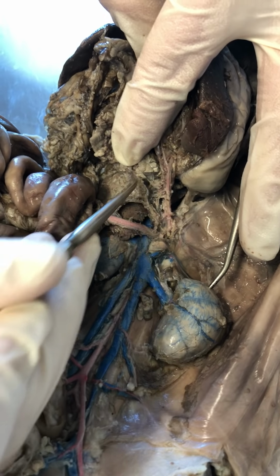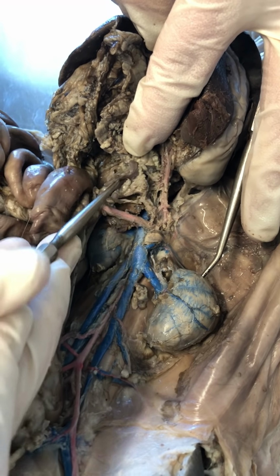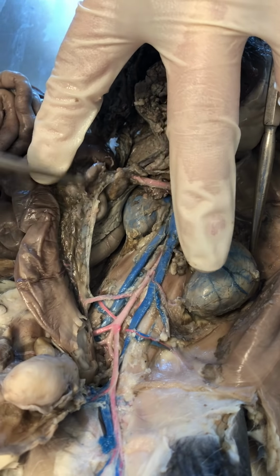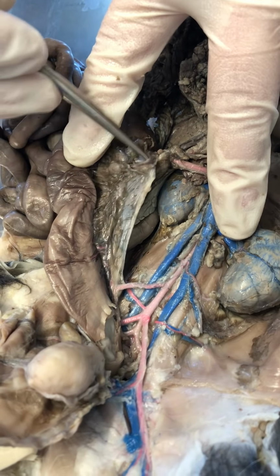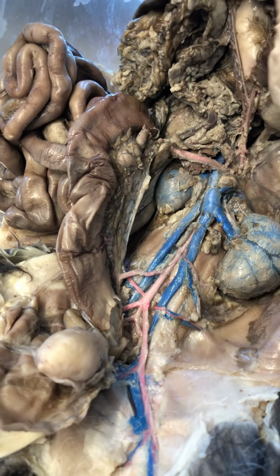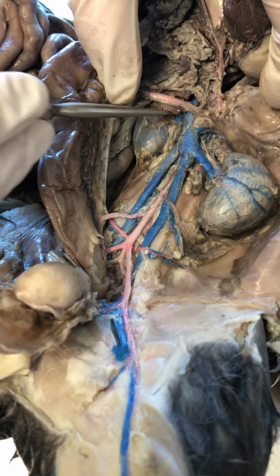And then you can see down here, this purple vein right here. Okay, see that? That is my superior mesenteric vein. And then my inferior mesenteric vein, if I move through this tissue, okay, see it right there? That is my inferior mesenteric vein branching off the superior. Okay, so I can get the yellow one out and show it to you a little more clearly. Okay. So then we're not going to worry about anything for the veins until the kidneys.